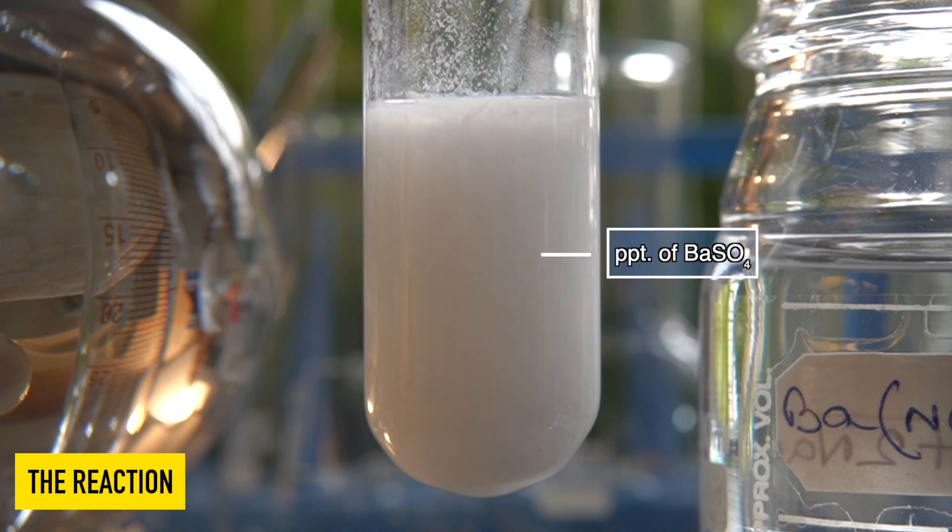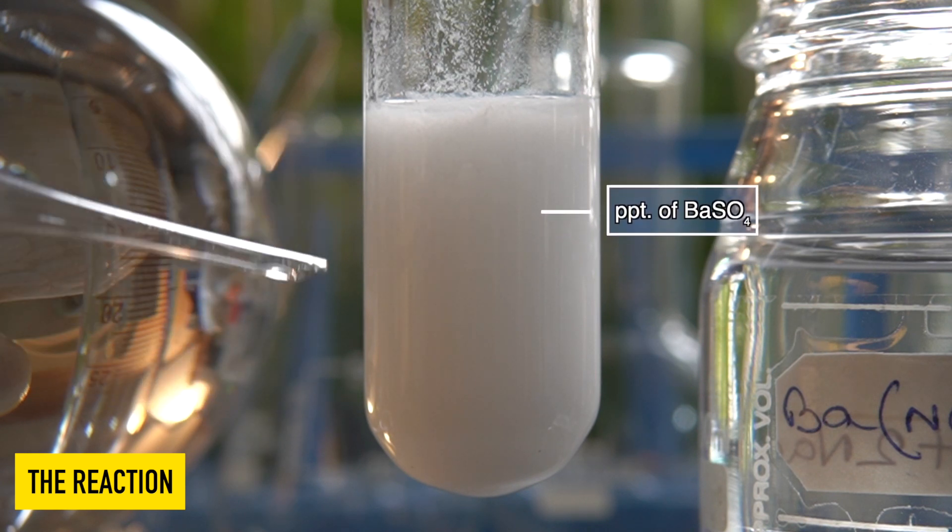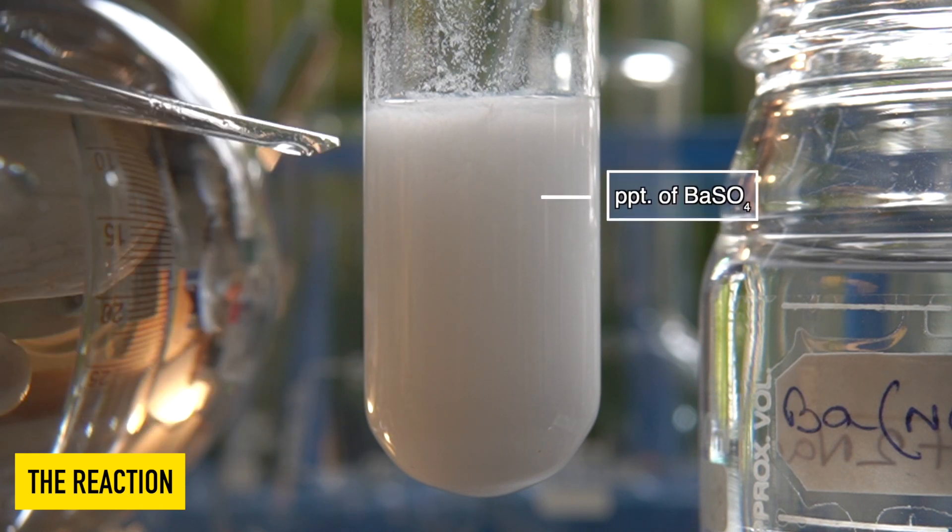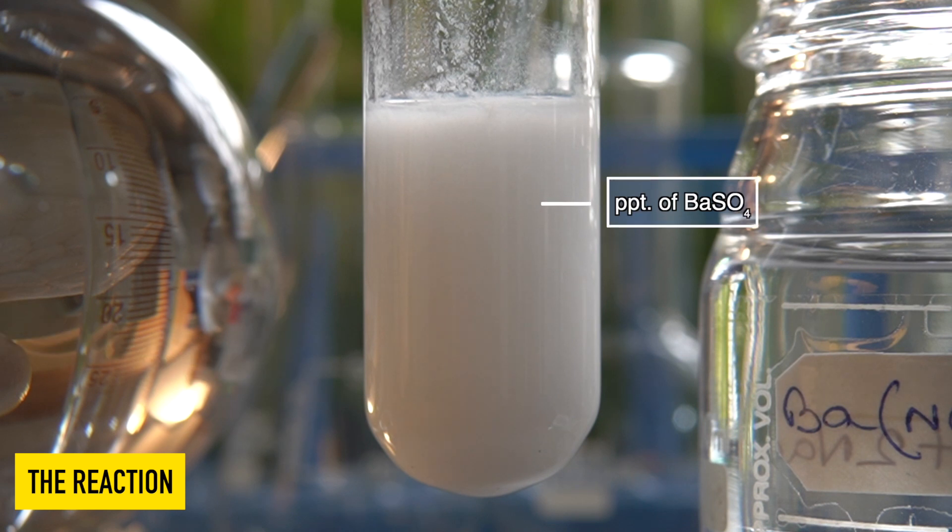The insoluble white precipitate that has been formed inside the test tube is nothing but barium sulfate.